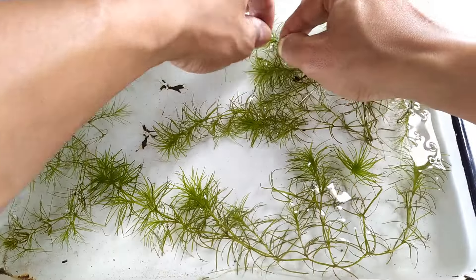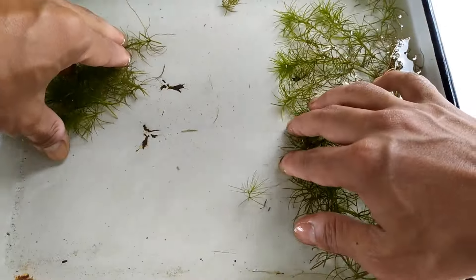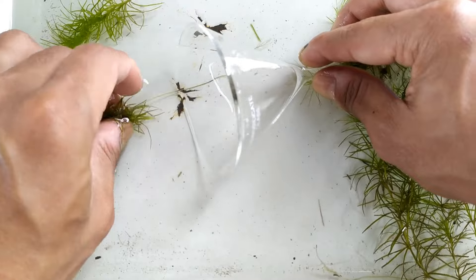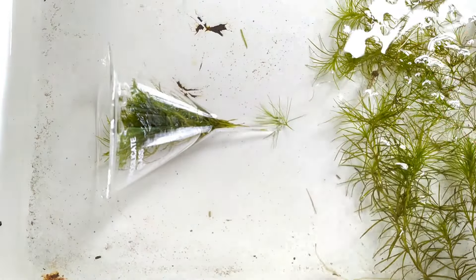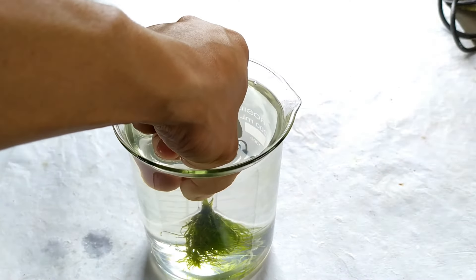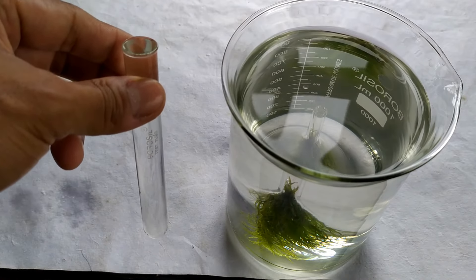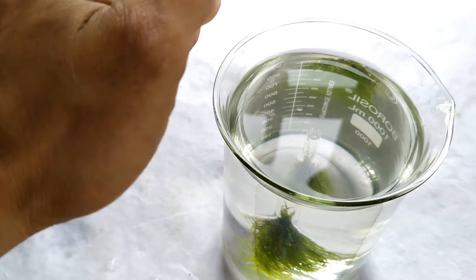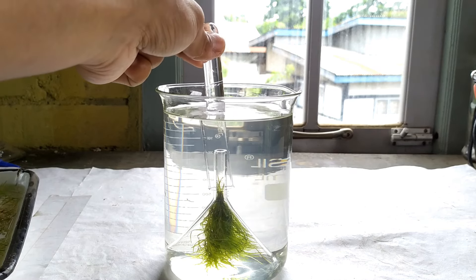To begin the experiment, take a few twigs of the aquatic plant and insert the cut ends of their stems into the tube of the funnel. Now, fill the test tube to the brim with water, hold the mouth of the tube with your thumb and invert the tube into the beaker, and let it sit over the tube of the funnel as shown in the video.